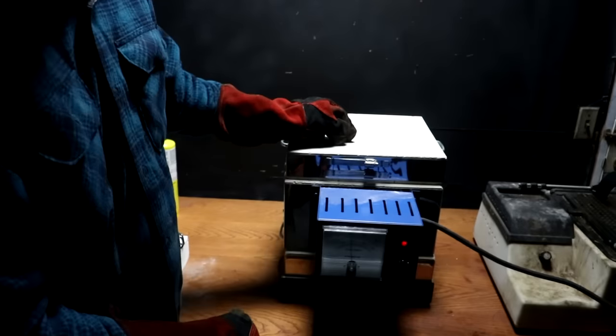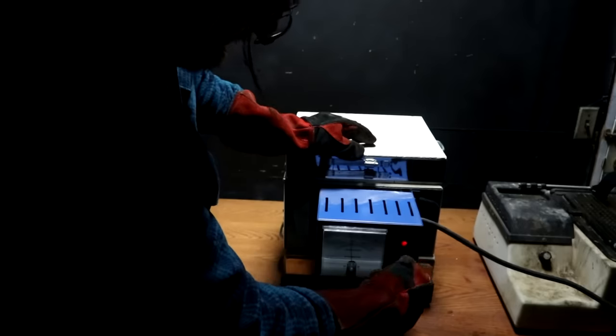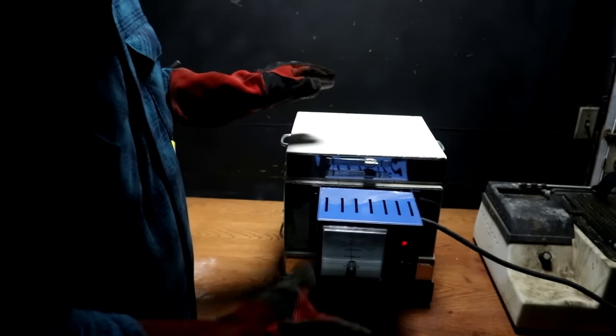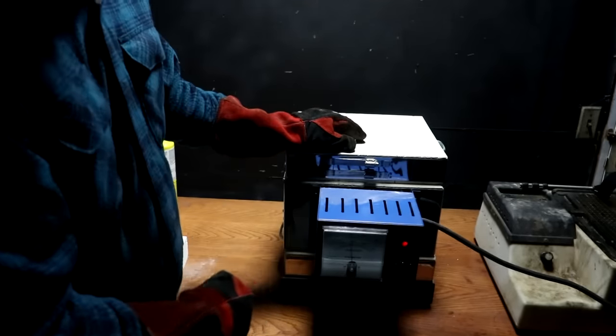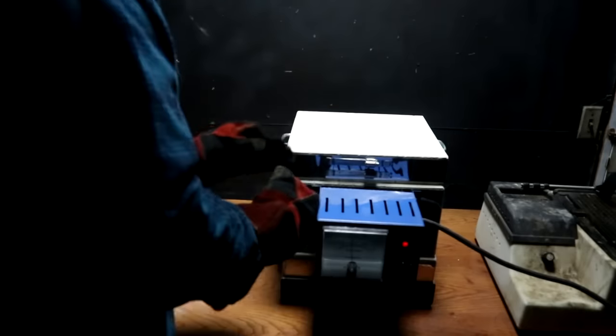Looks pretty good. Let's put it back in the furnace so that it can stay hot until we can slowly cool it off. All right, well, I got it in there. It hasn't broke yet, so I'm gonna let this slowly cool off, and hopefully we'll have a working distillation adapter by the end of this.